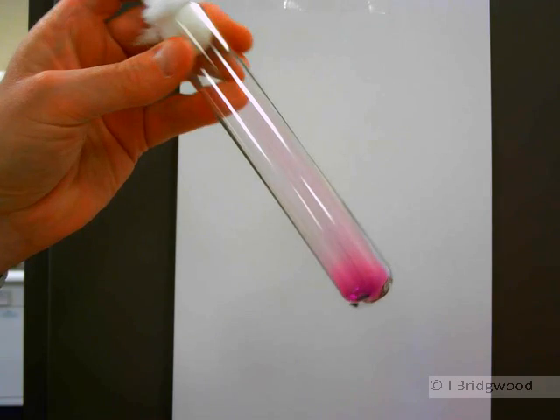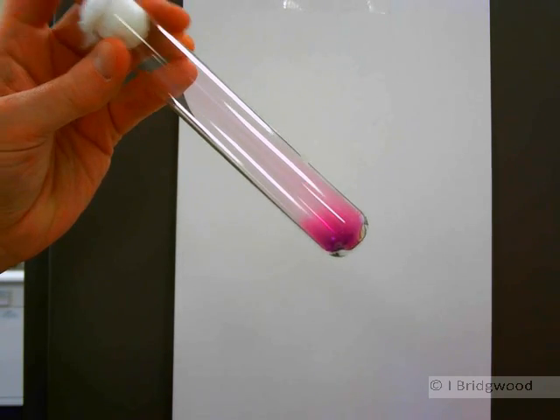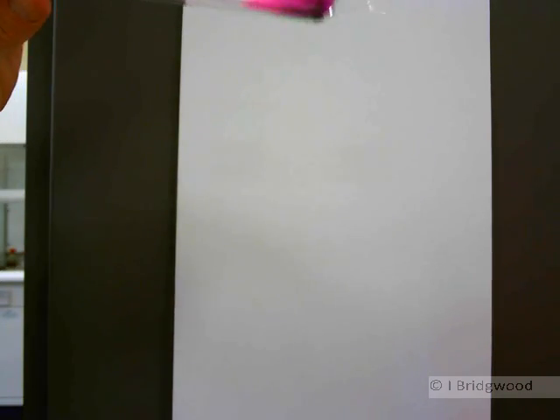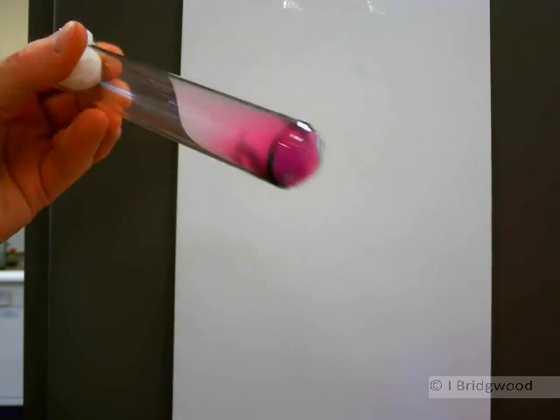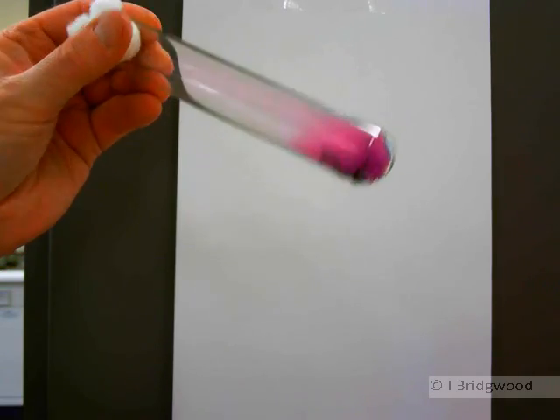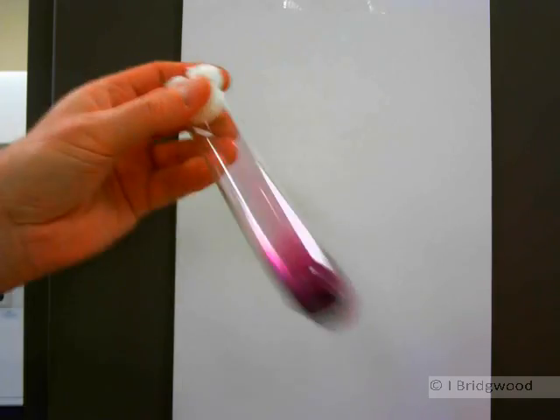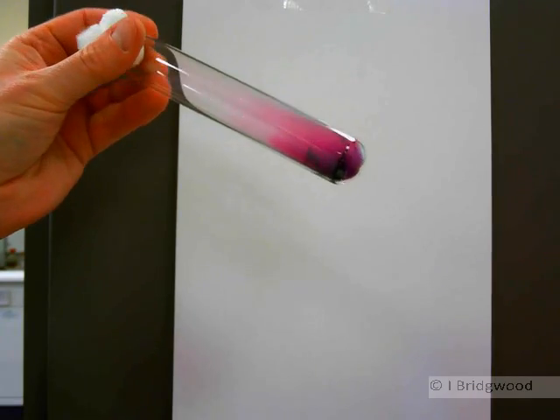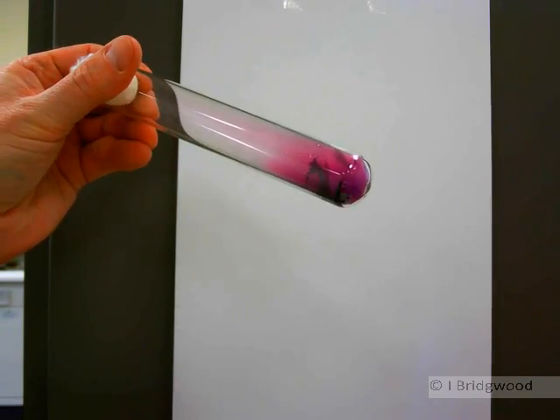And in fact we're moving from the solid phase into the vapor phase very quickly. Now sometimes you're told that iodine moves from the solid to the vapor phase without going through the liquid phase. But you can probably see just a little bit of liquid there.